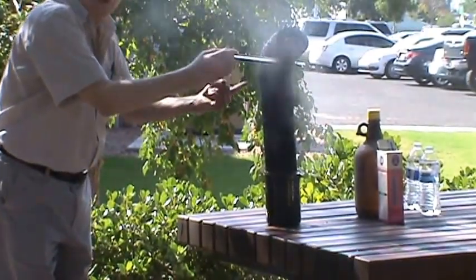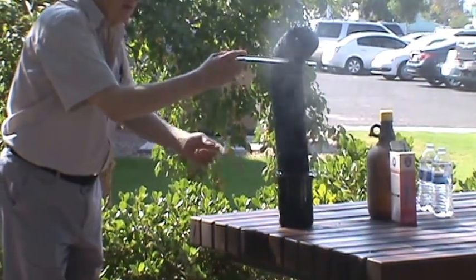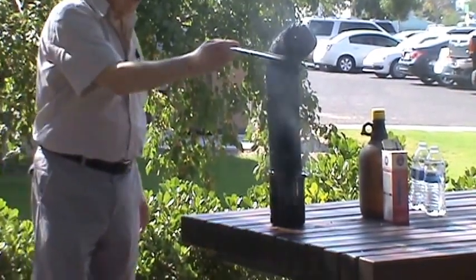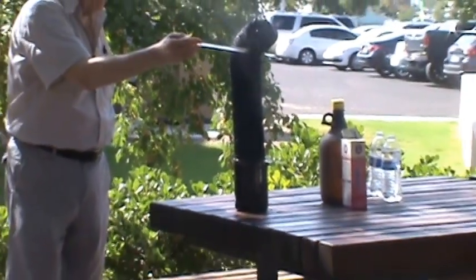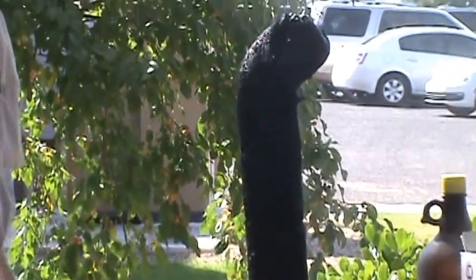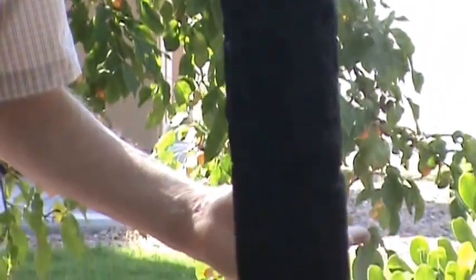So this is basically pure carbon. The water, as combined with the sulfuric acid, is going off as vapor, which you should not breathe. Too late. Oh, there it is. I guess we can end the demo at this point.